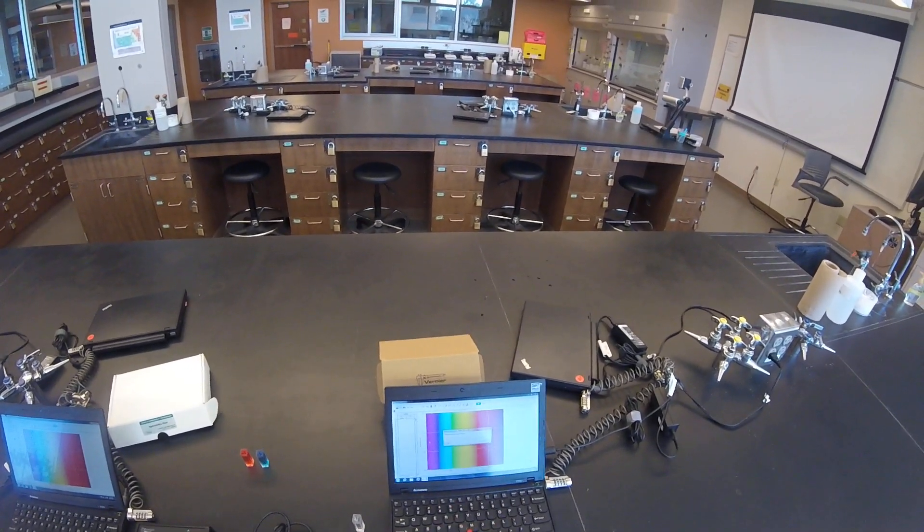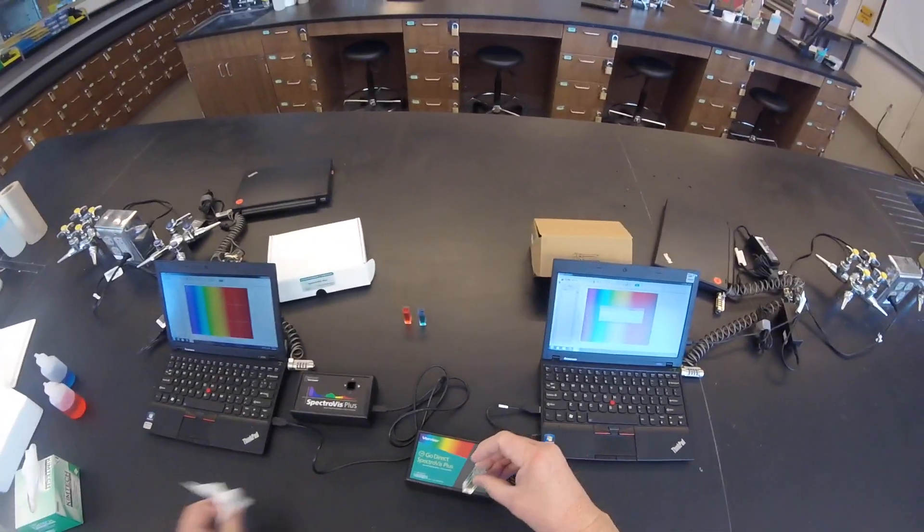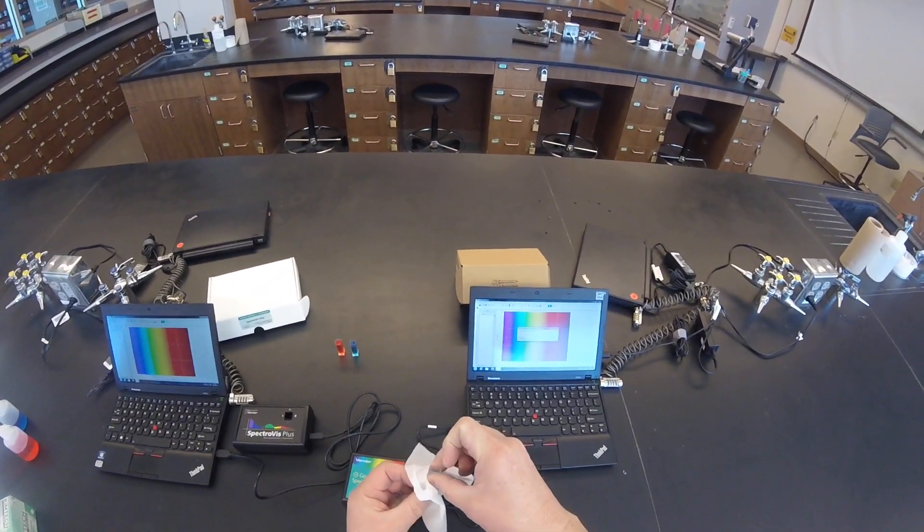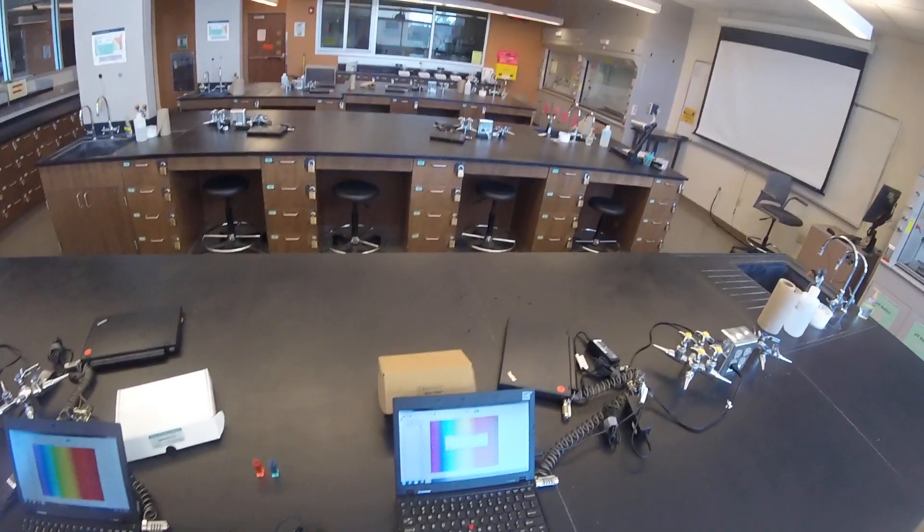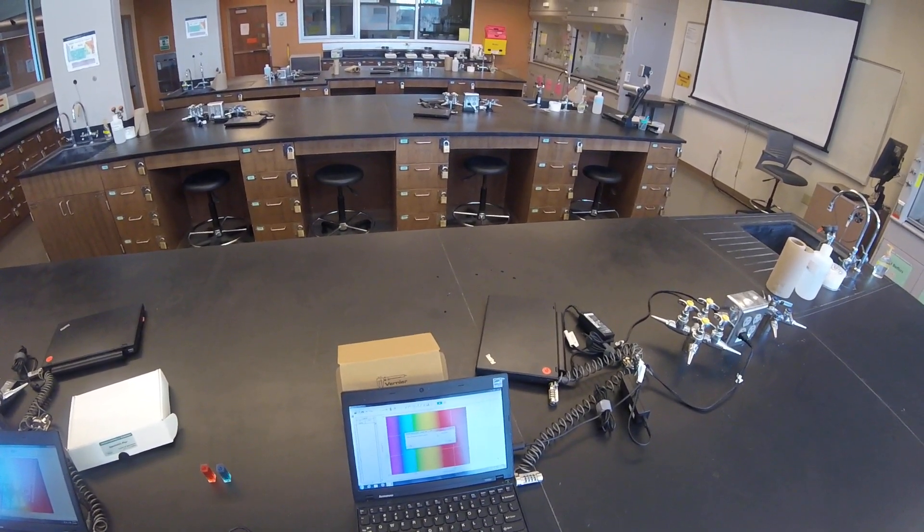It will also give you a 90-second lamp warm up. You'll notice that I'm wiping down the sides of my cuvette with Kim Wipe to get any fingerprints off of it. And you'll see after a few seconds, the Skip Warm Up is now active.